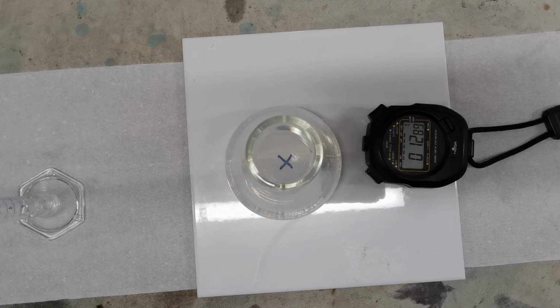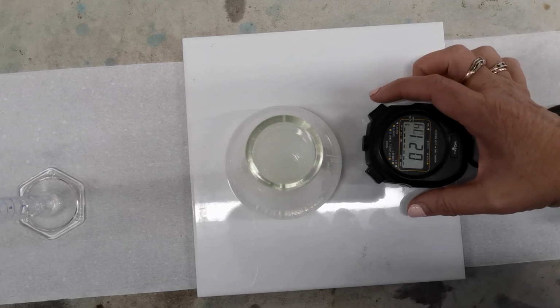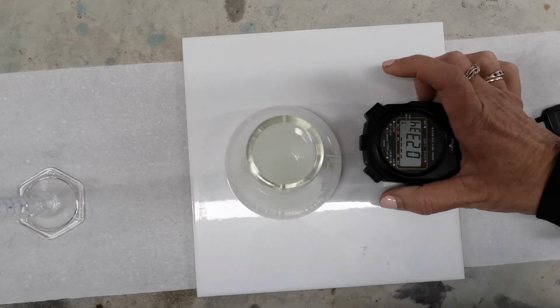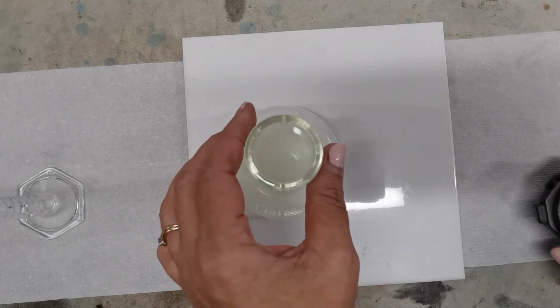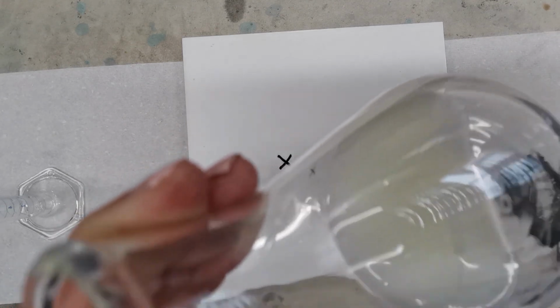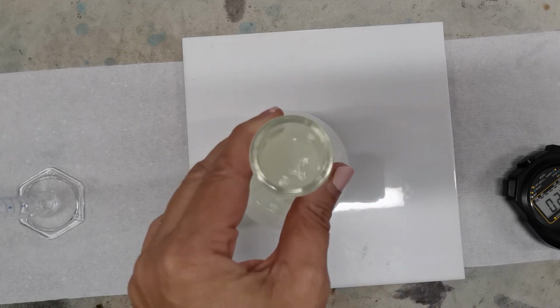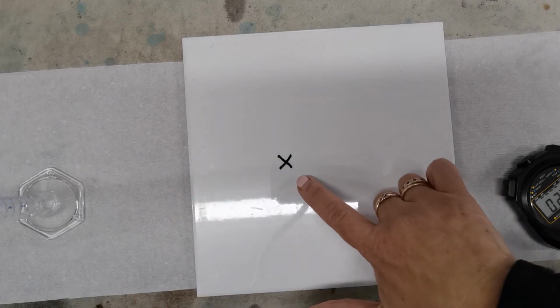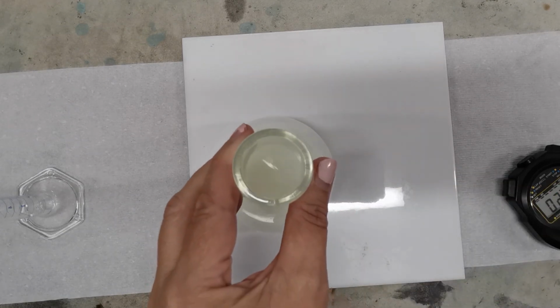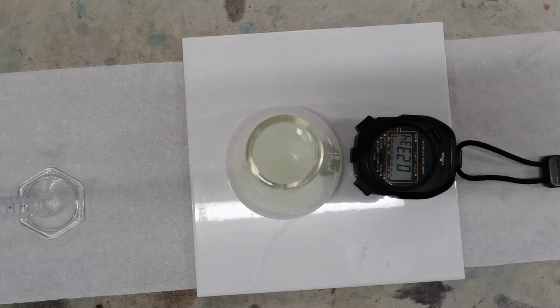I can gradually see it starting to precipitate now. It's getting quite cloudy in the solution. And stop. Okay. If you can see, the solution's actually got quite a milky look to it now. That solid substance that's in there is actually the sulfur. Now that has made that solution so milky that we cannot see through the glass to see the cross on the tile there. Now that took 23 seconds to react.